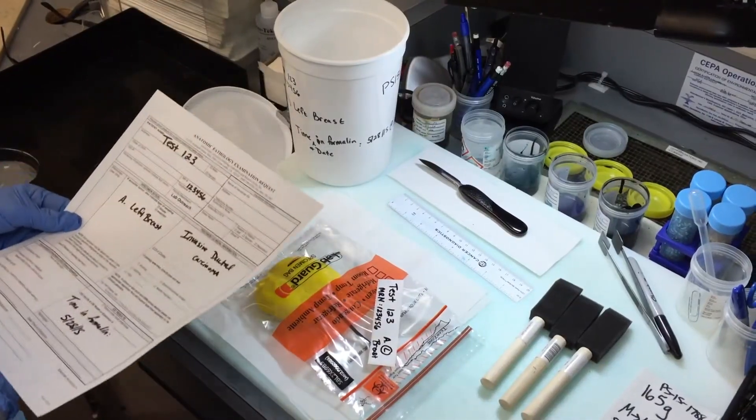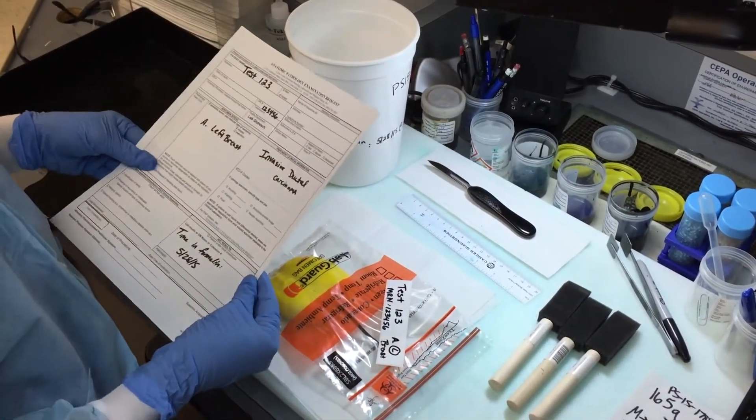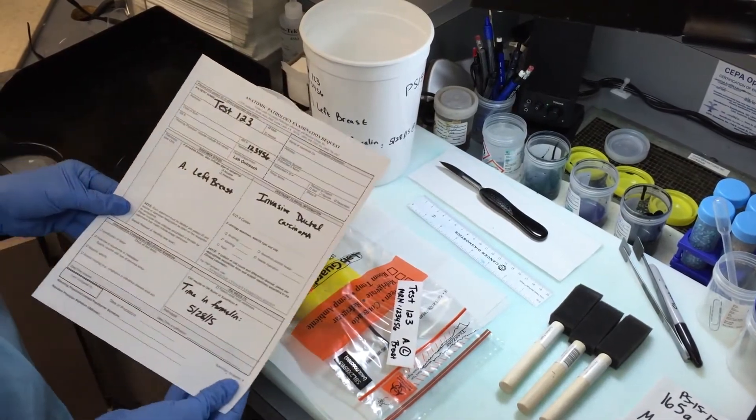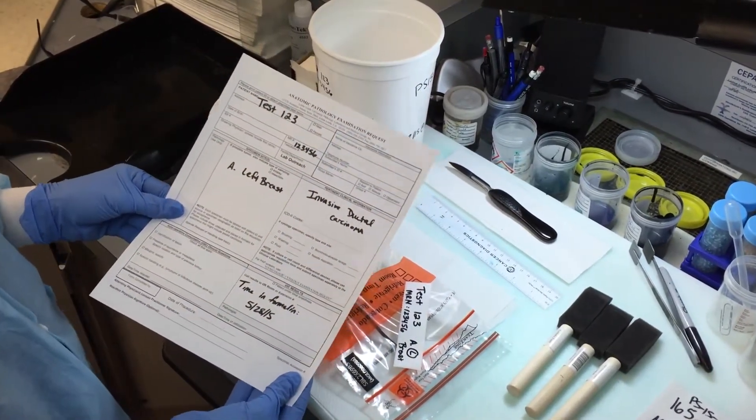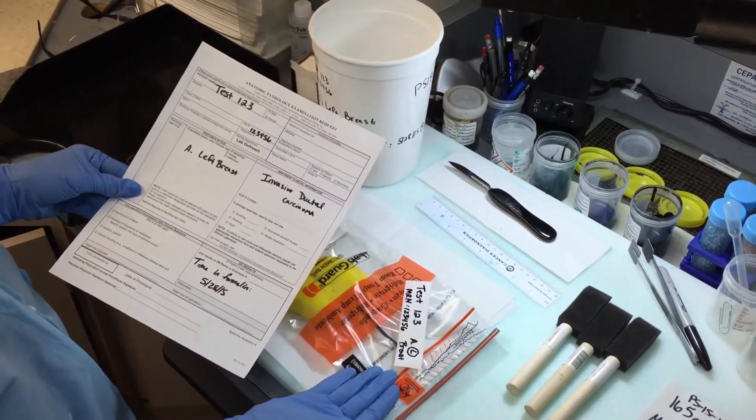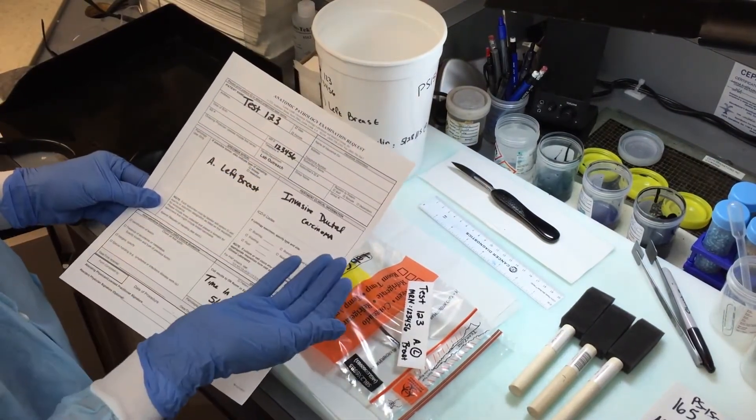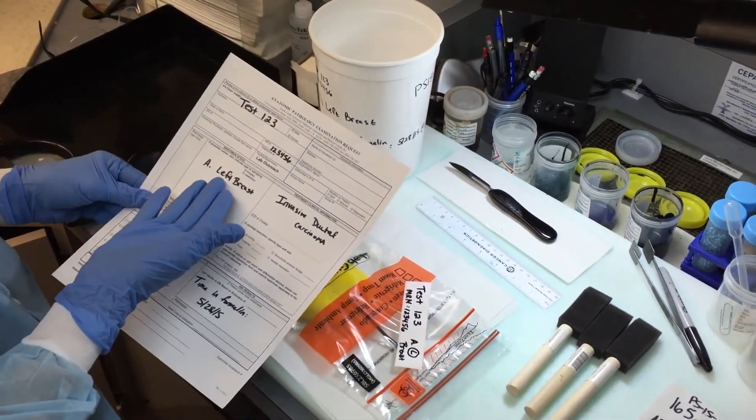Okay, so part one will be day one when you first receive the breast tissue. First thing you want to do is check the requisition and make sure that the label on the specimen bag matches with the requisition and also that the specimen is the same.